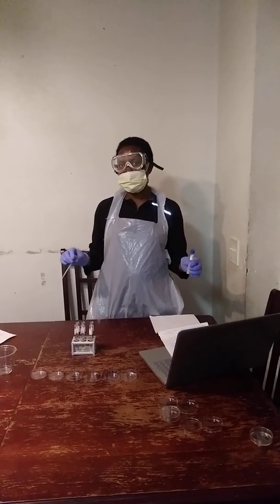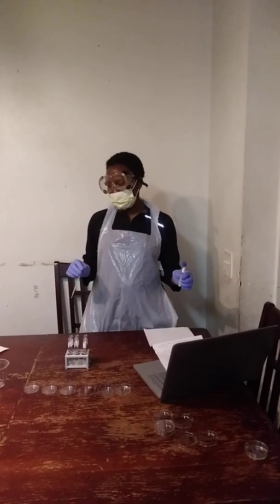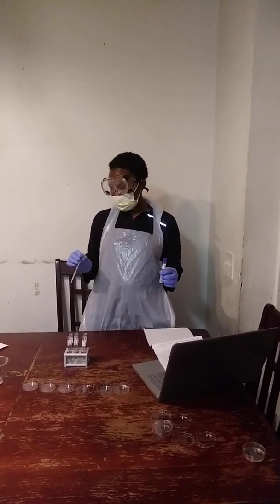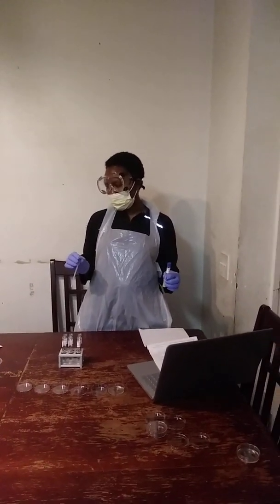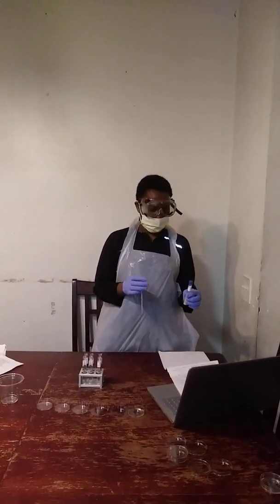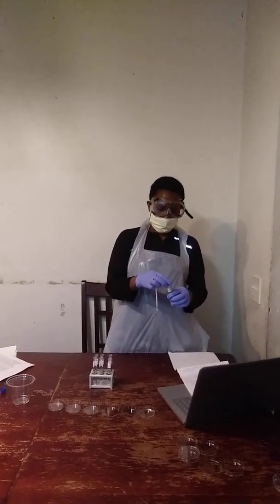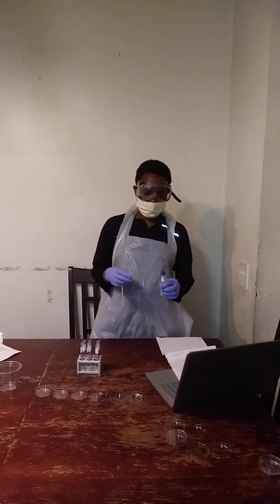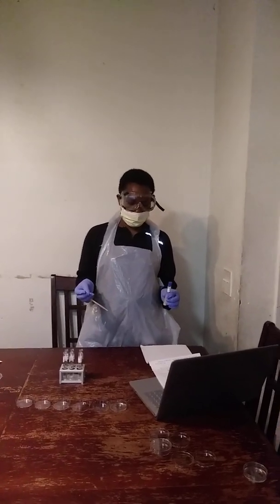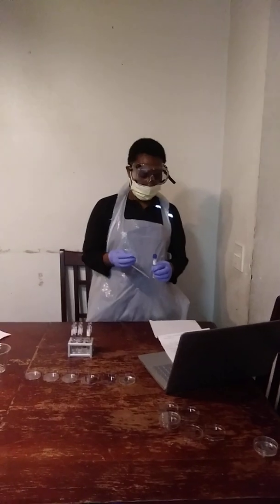Beatrice Mwanya. Today is the 24th of January 2020, and here I am doing bacterial enumeration, dilutions, and plate counts, of which I will define some terminologies like viable plate count. This is performed by estimating the number of bacteria or fungi which have multiplied through binary fission under controlled conditions.